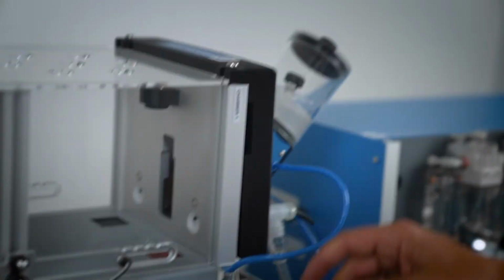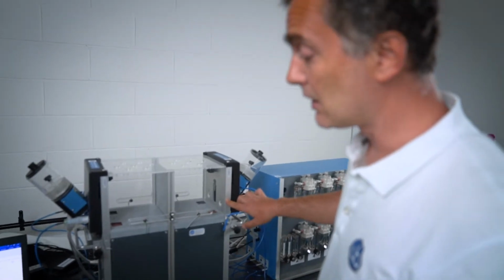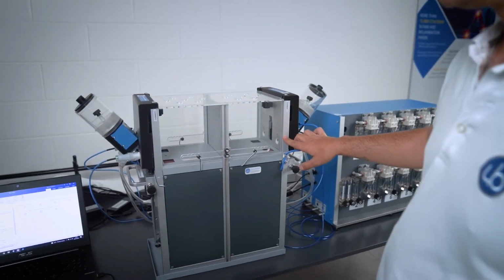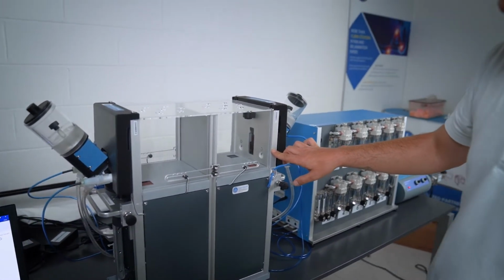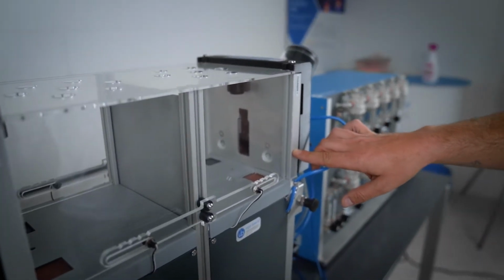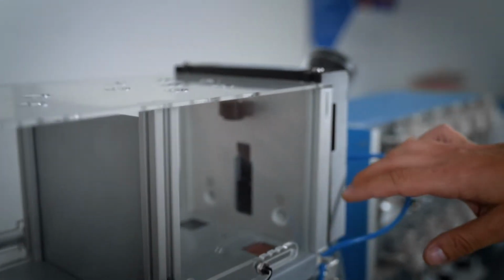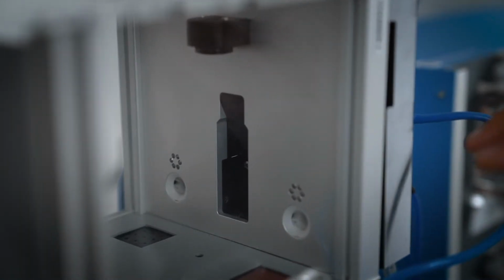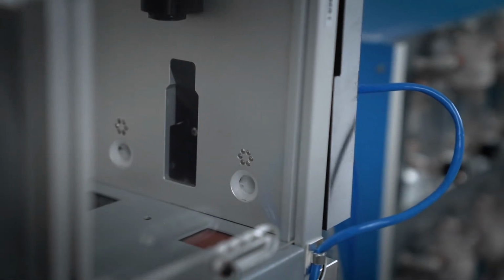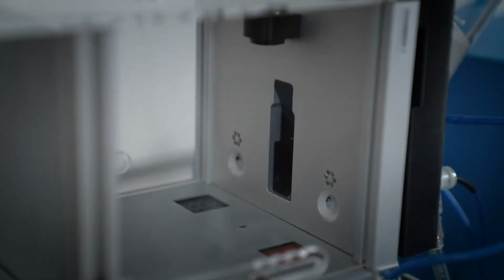And you can also customize it with your own type of textures. Within each nose poke, there is a photo beam so that you can measure the nose pokes and successes of the animal, of what you're asking in the test. And there are also lights. So the third dimension is light. And you can do intra-dimensional or extra-dimensional attentional set shifting experiments here.